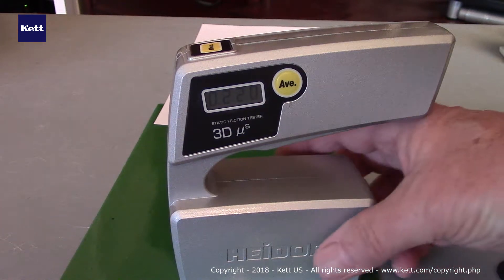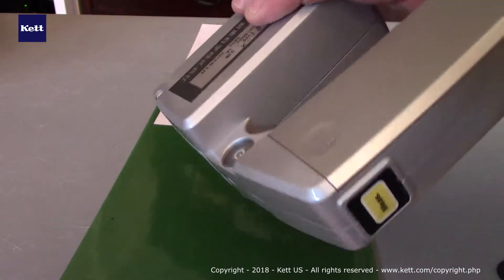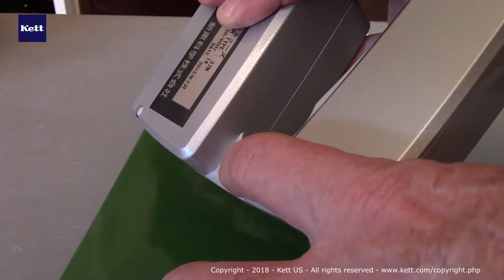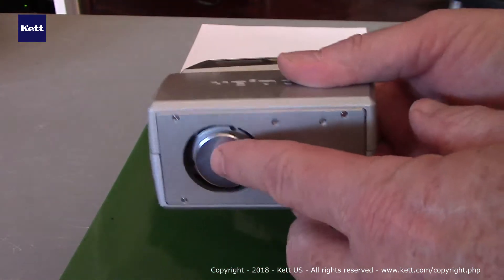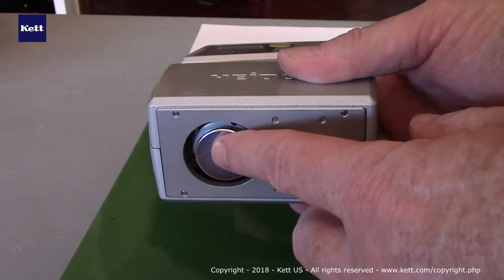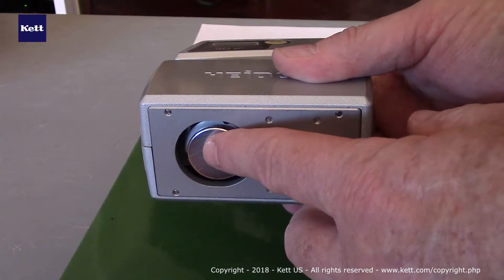The way this is used, it has four AA batteries that are placed in here. There's a power button, which we've already pressed here, which starts it up. On the bottom you put a test fixture that we call a jig. We offer a tool that comes with it that allows that to be quickly put on or off.